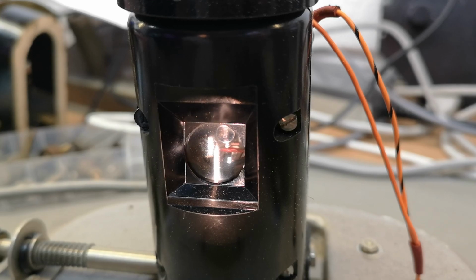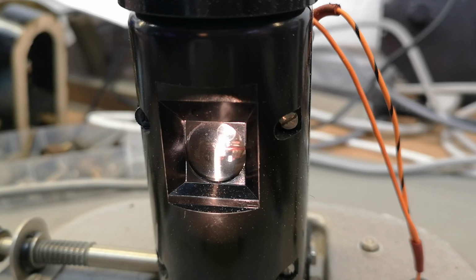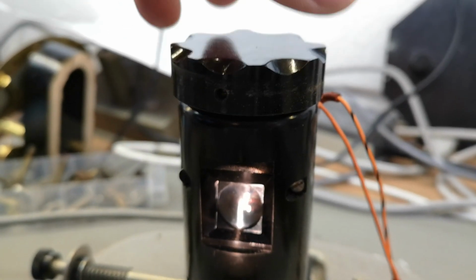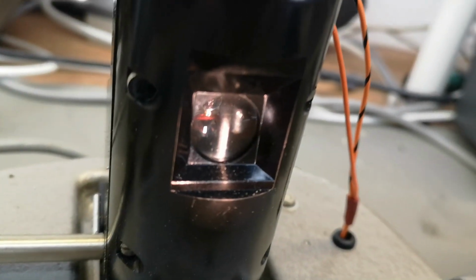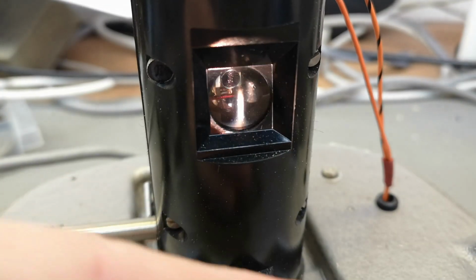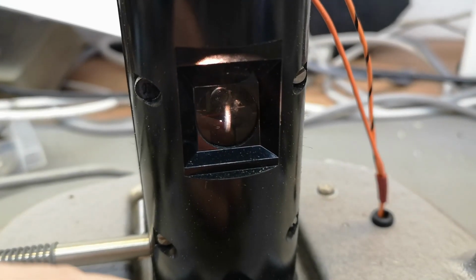Isn't that just cute? This kind of readout. Now I block the light completely, and then I can adjust the set 0, see? A little bit. And then of course I can hit this dial and then crank it down to the infinity symbol. But there. Here you go. If I block down here, it's probably... No, yeah, okay. It's not so easy to see. Tiny little mirror up there.